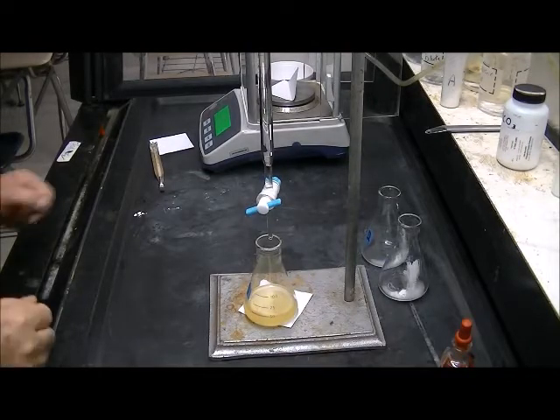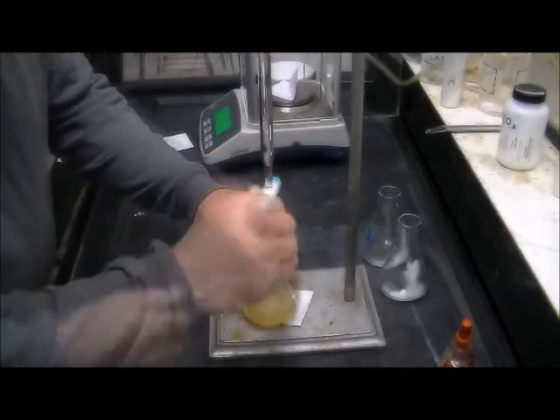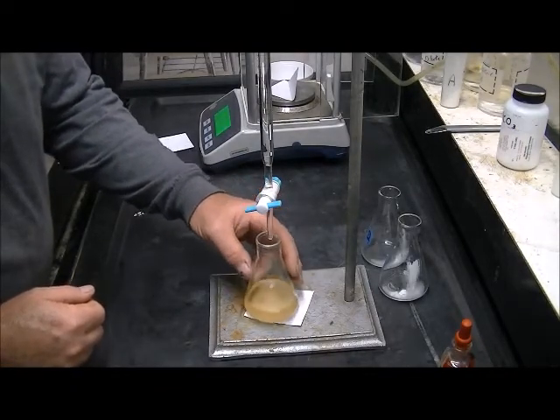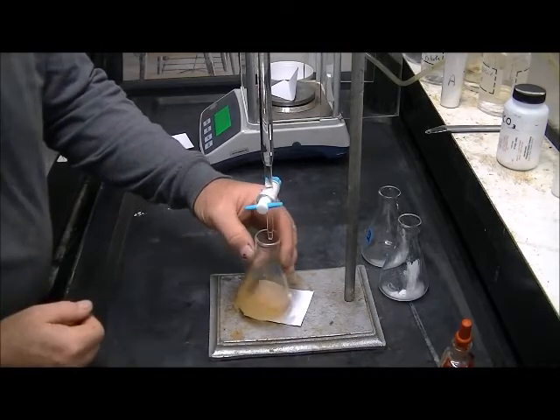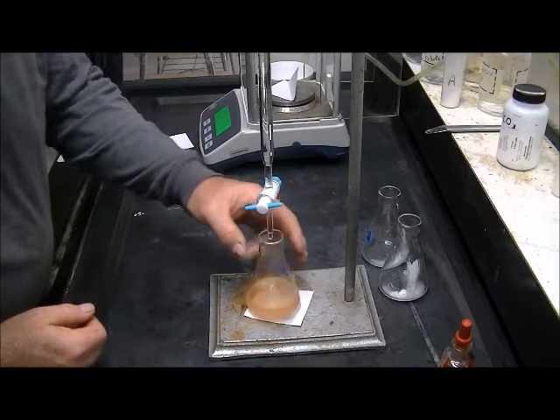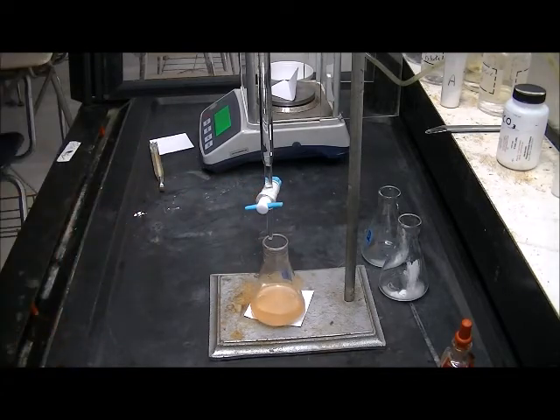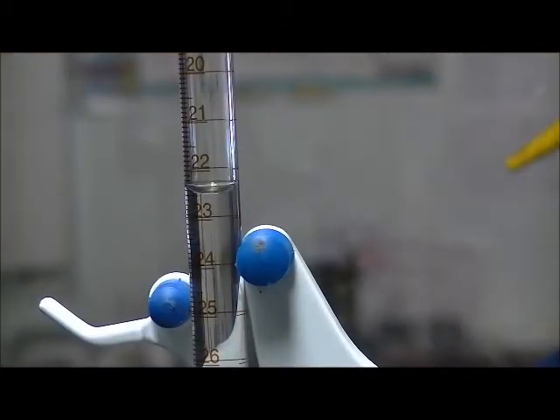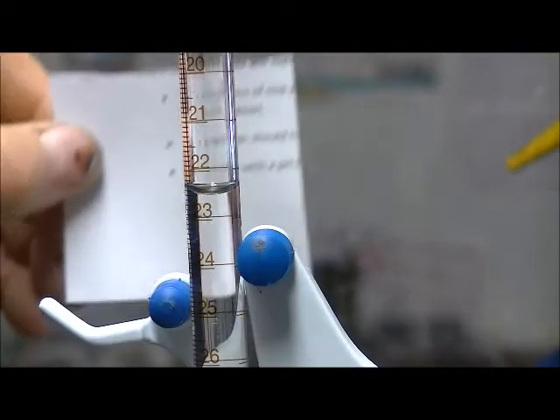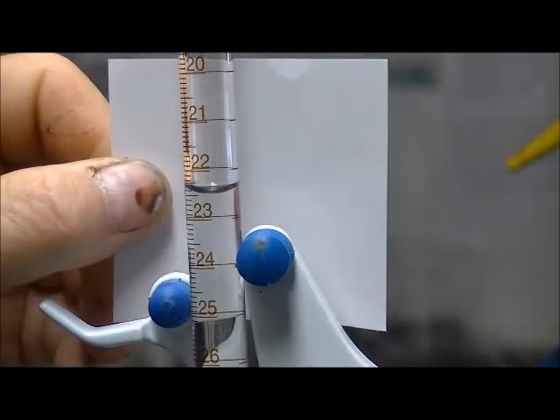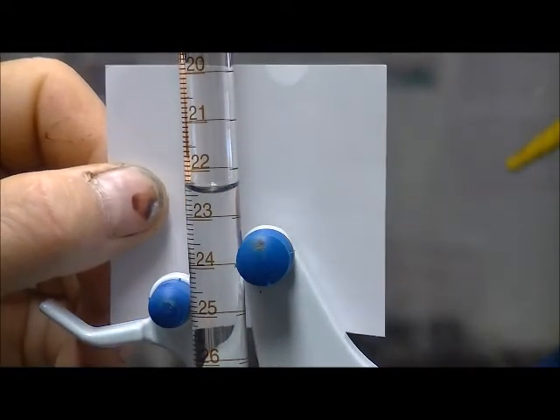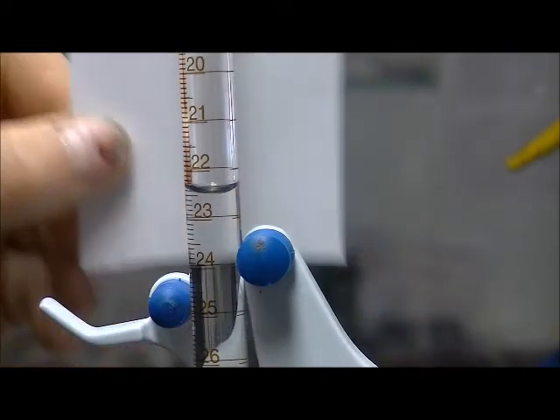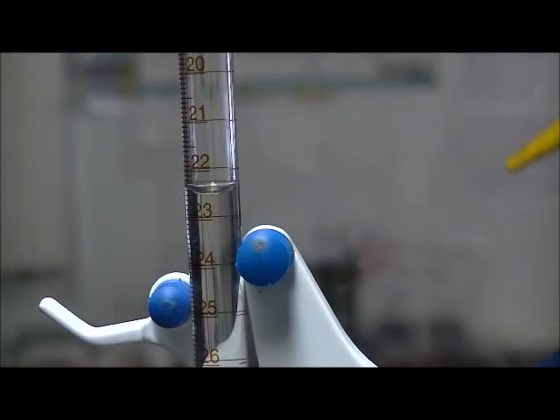This is unknown B, sample 1. Just a really quick little splash. Not quite. Okay, that's it. Two colors there. And unknown B, sample 1, 22.5 milliliters.